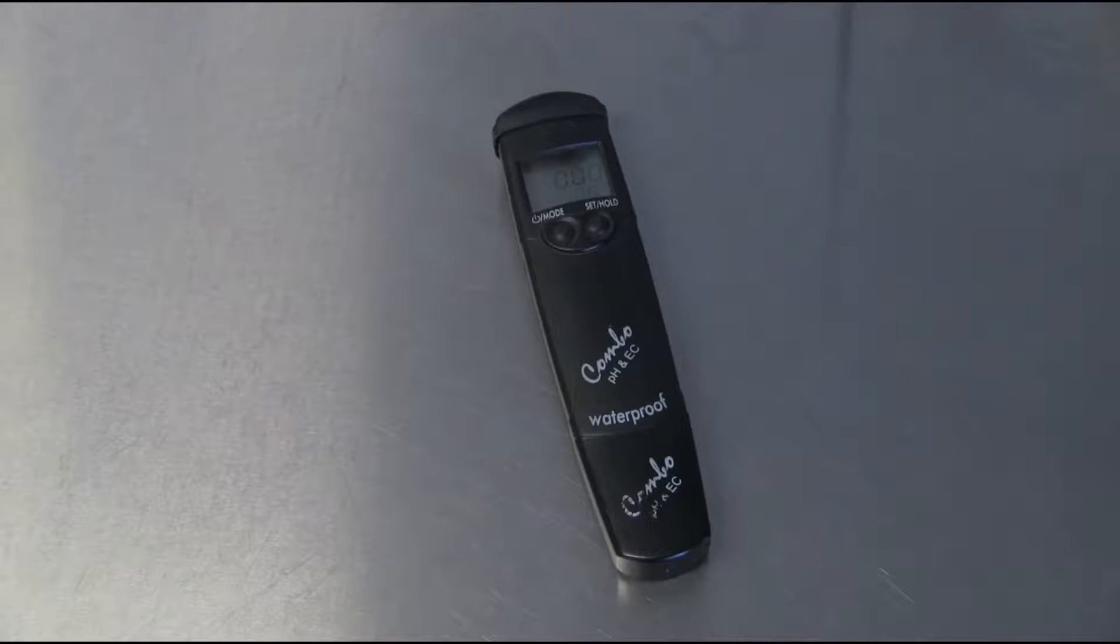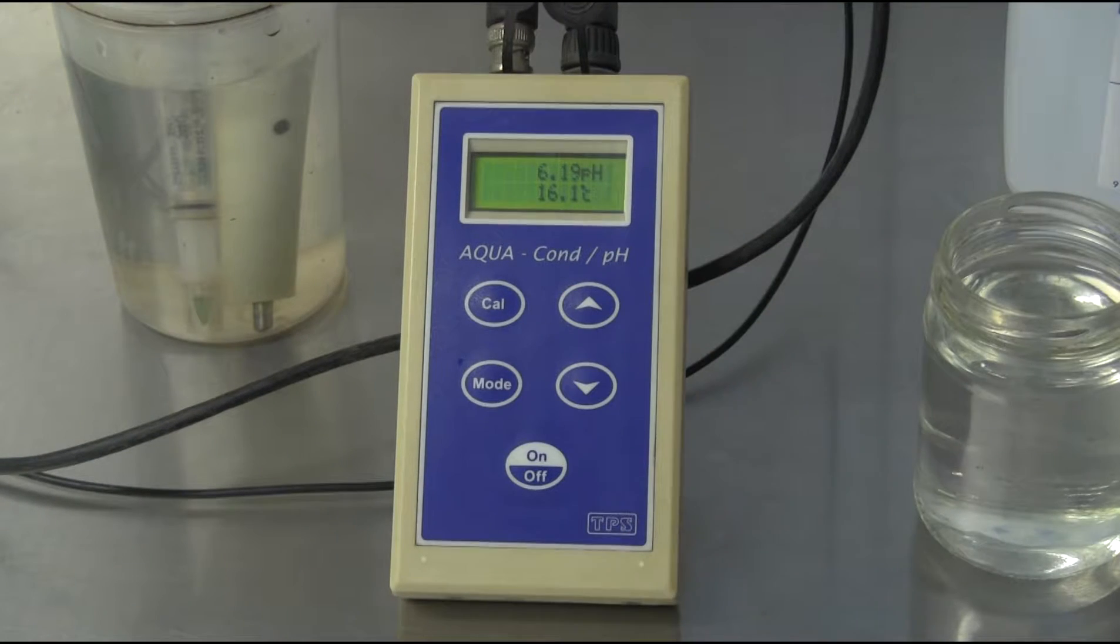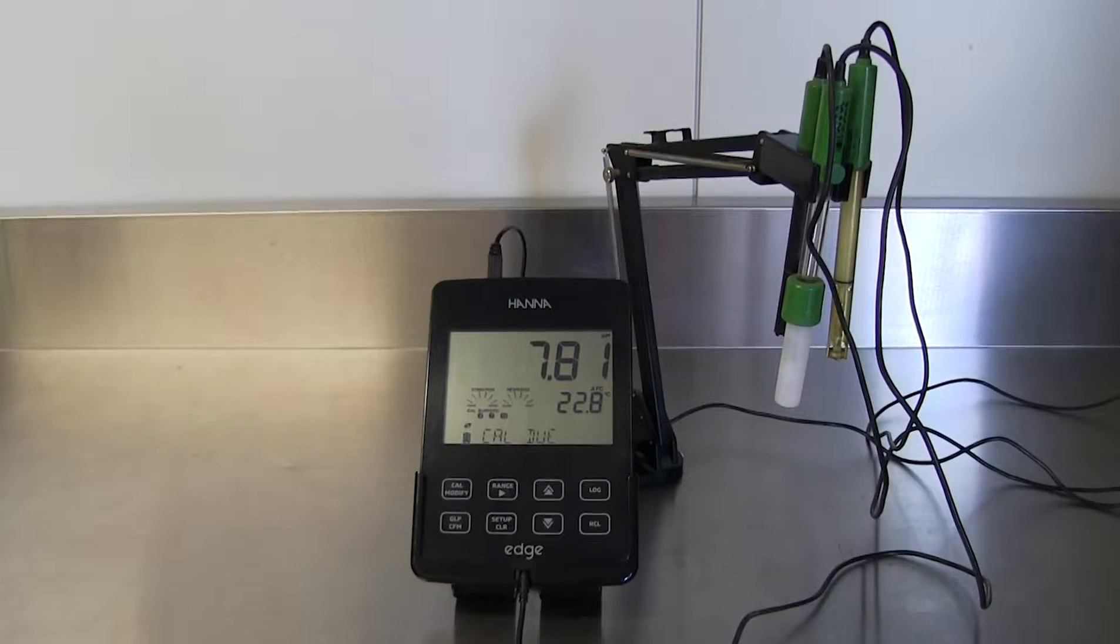There are many different models of meters available, ranging from relatively inexpensive pocket meters to more robust and expensive top-of-the-range bench meters. Calibration procedures differ for each type and model.